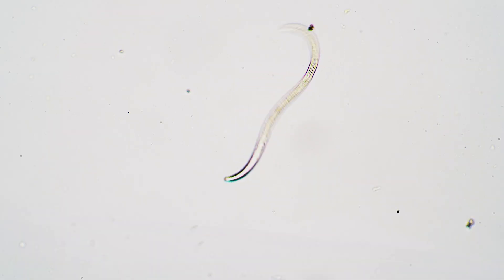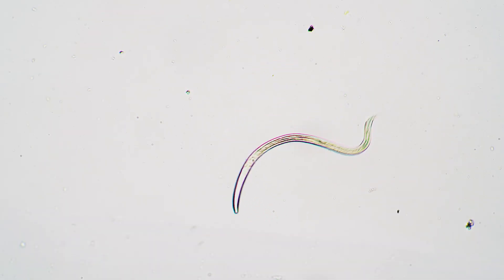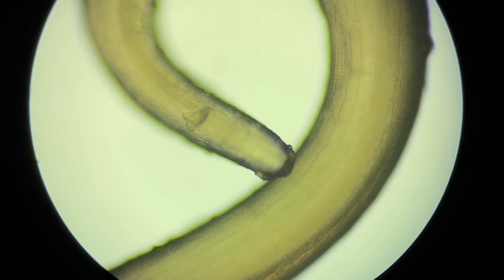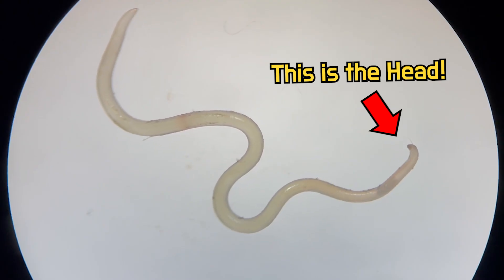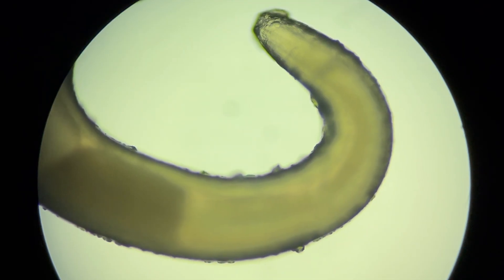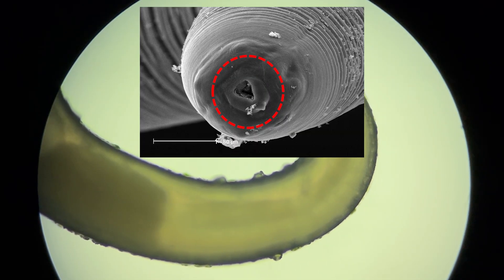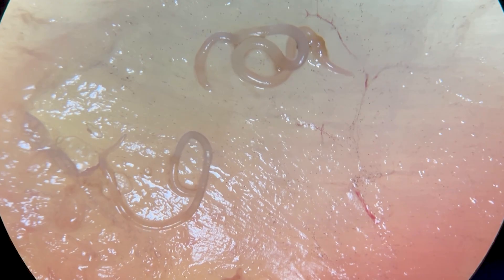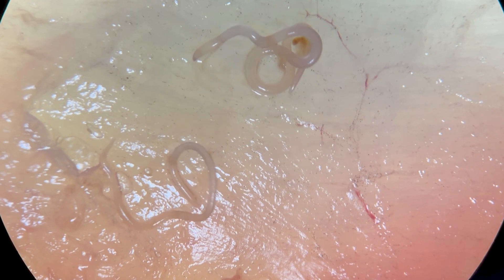The body of nematodes tapers towards the back, with the rear end being pointed and the front end being blunt. So the blunt end is the head. Although not well visible with the microscope I have, there is a mouth at the end of the head.